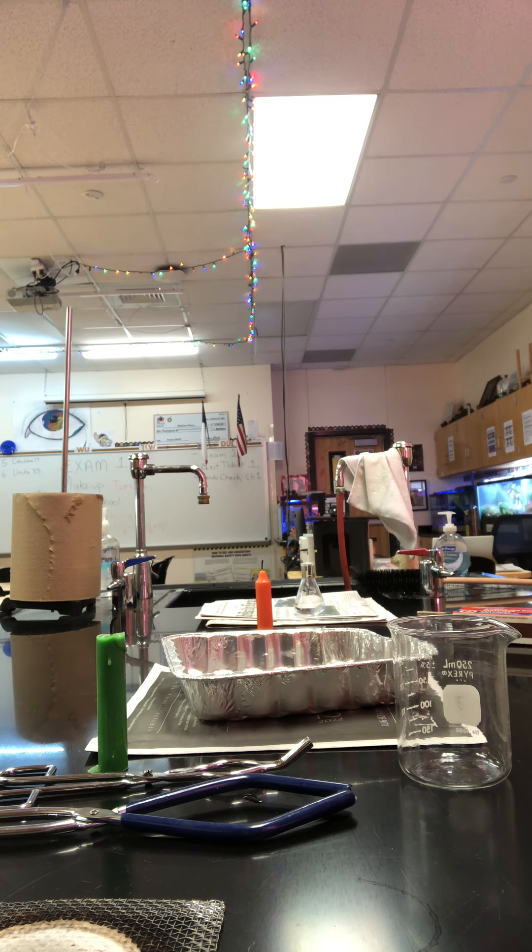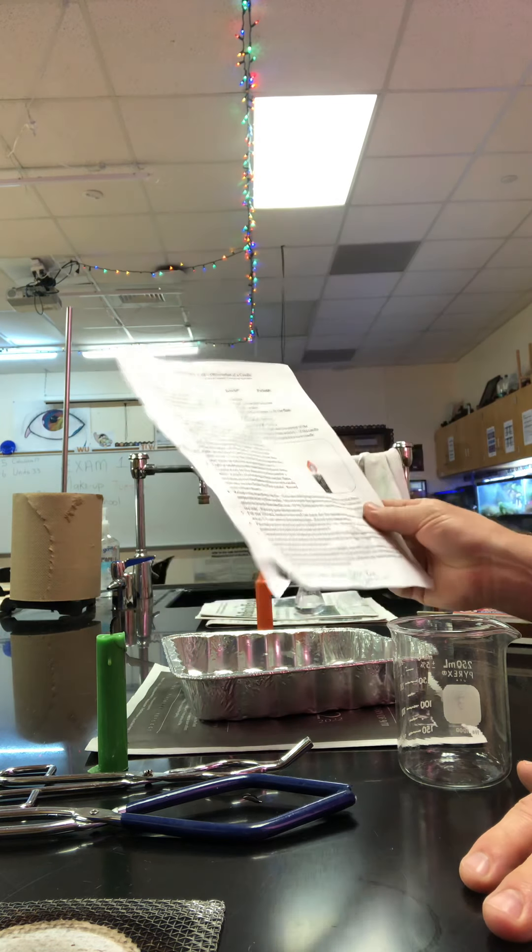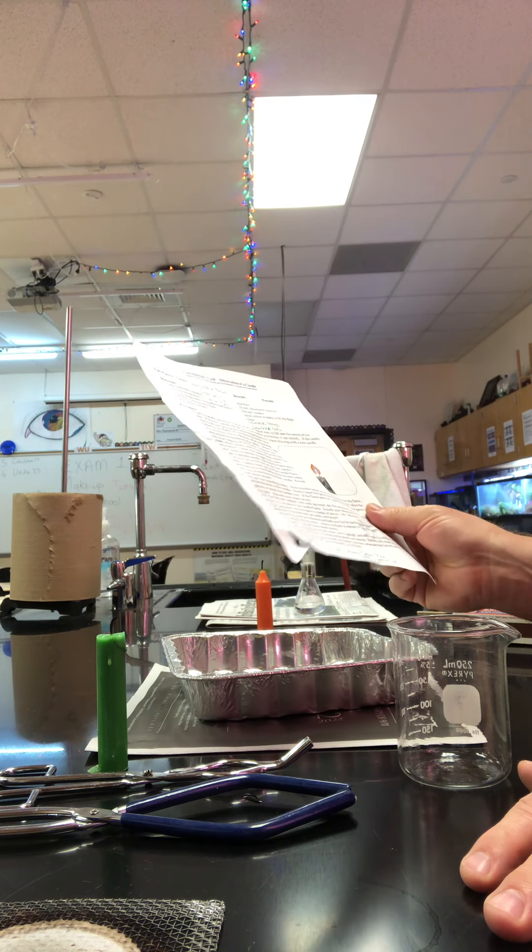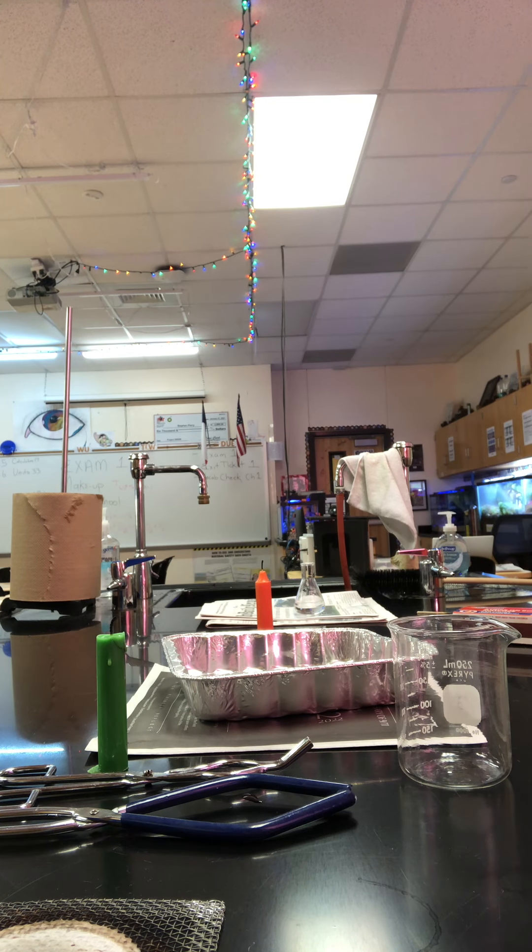Alright, so if you're at home you will watch the video and then you'll be able to fill out your lab report. You can find this in Canvas chemistry lab observation of a candle. So I'll briefly read through the steps and then we'll get into the lab.